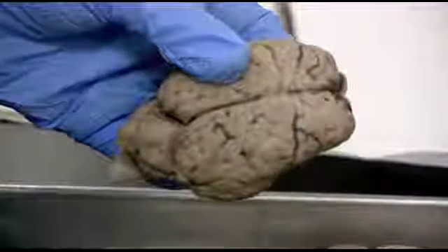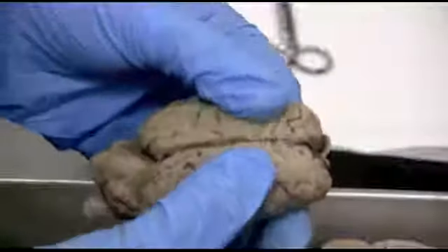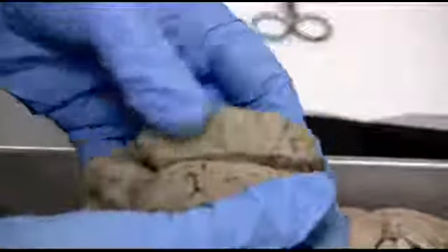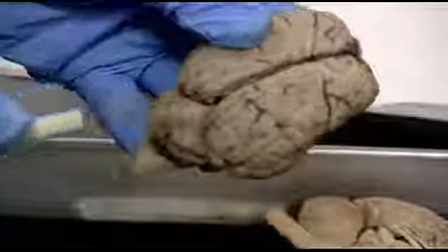It would be like a swimming cap over the top here, very hard and durable, but we've already had that removed. So if I just tease those membranous layers apart, you can tell that there is no real connection between the cerebral hemispheres, the right and the left sides, until you get to the corpus callosum down in the middle, and that's where we'll have to cut through.